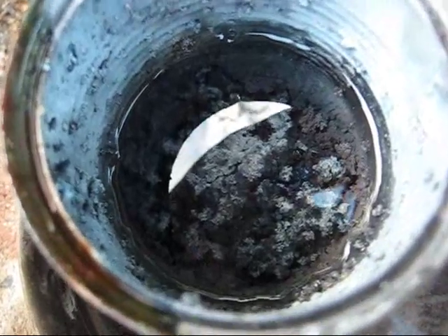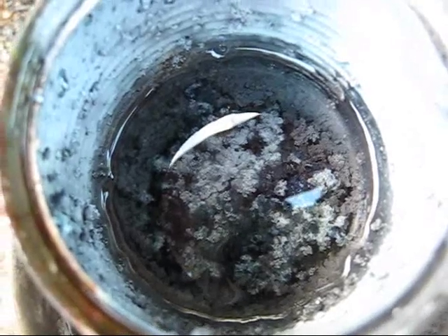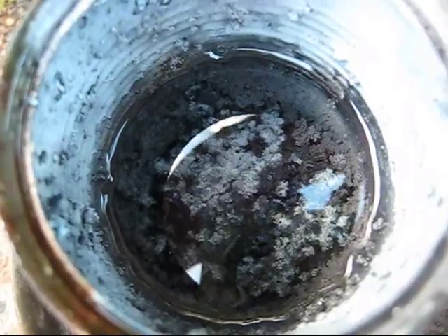In addition, this is how I plan on storing it. As soon as I take it out of there, I'll filter it off and remove some ingots hopefully, and maybe remelt it into one larger one, so we shall see here.